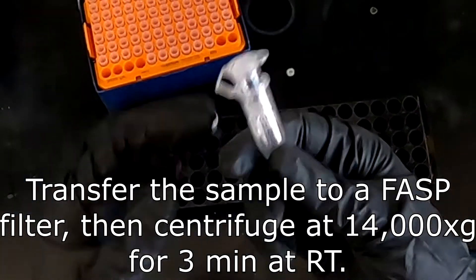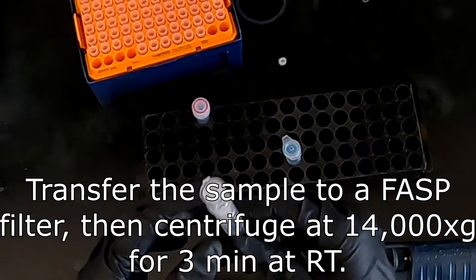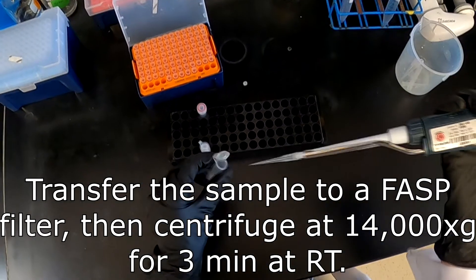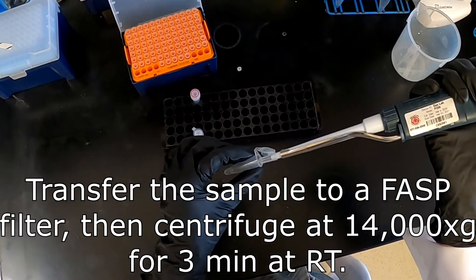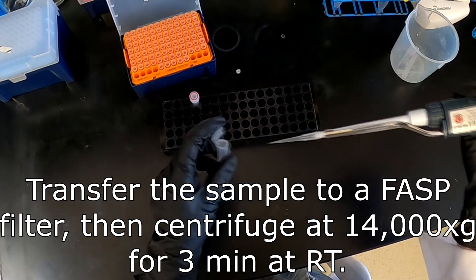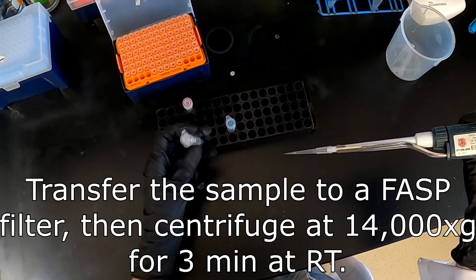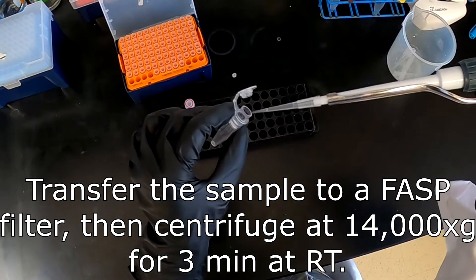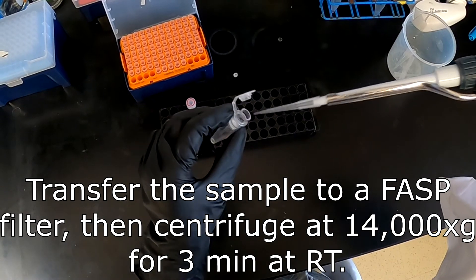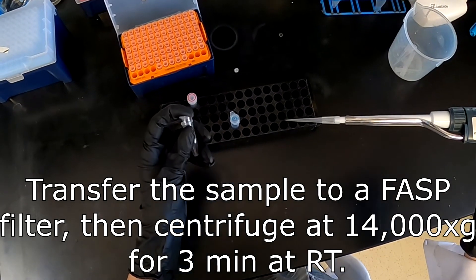The sample was then transferred to a FASP filter and centrifuged at 14,000 G for 3 minutes at room temperature. Performing these centrifugations at room temperature is important, because urea can precipitate and come out of solution if it is at a cold temperature.